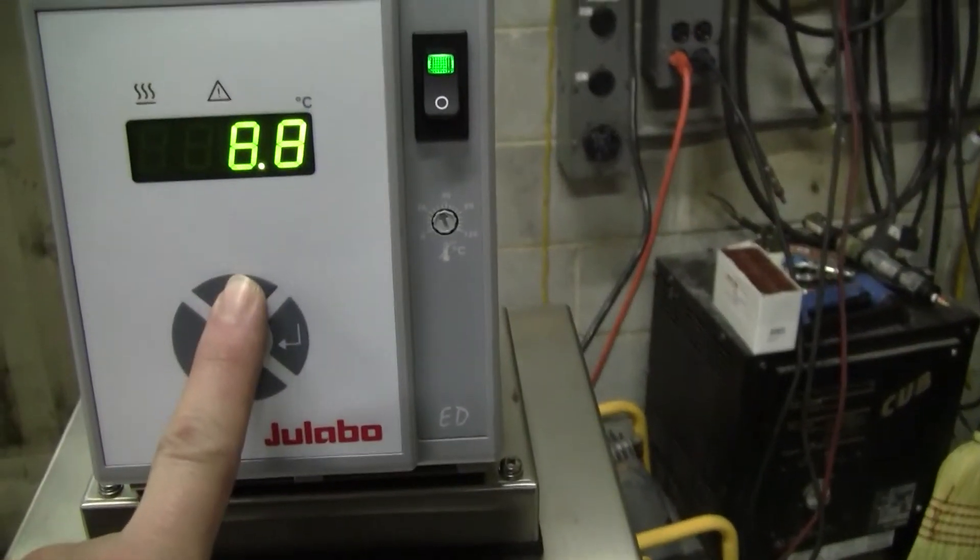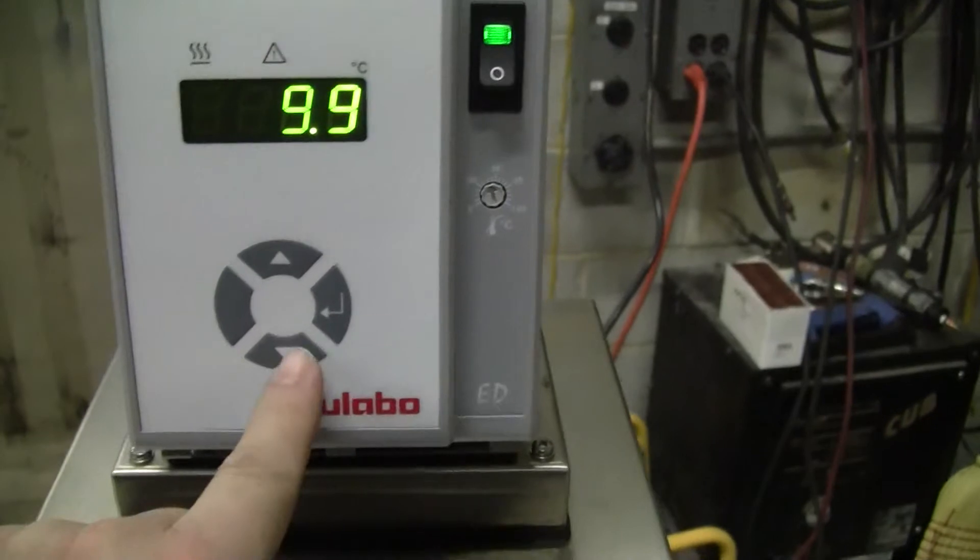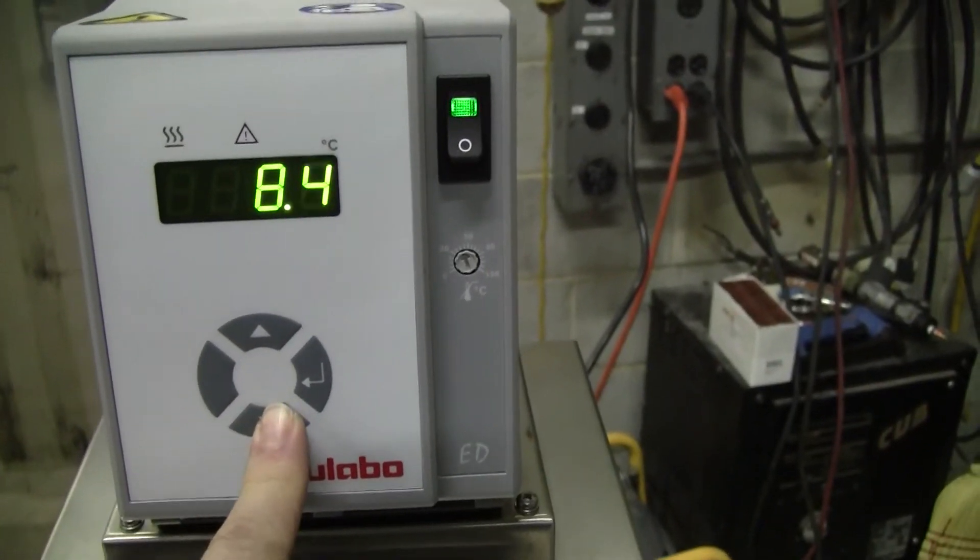Basically, it's up and down set point. Here we go, heating, chilling.